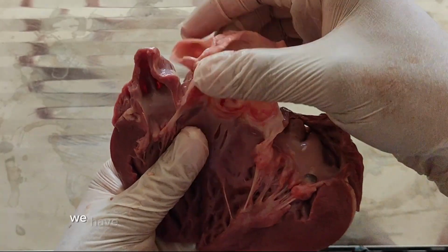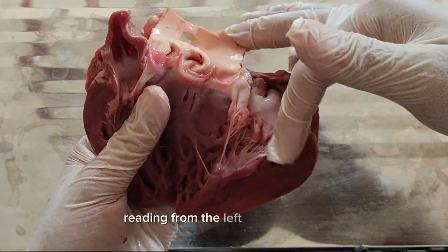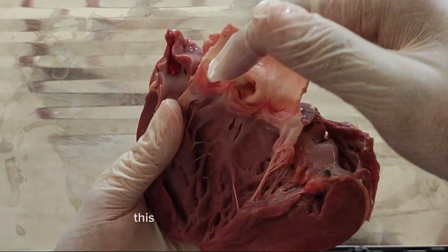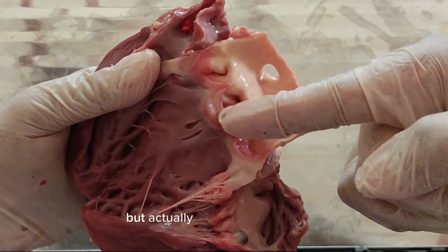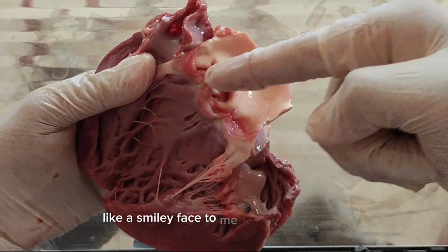On the inside, we have here the three flaps or leaflets on this valve leading from the left ventricle into the aorta, and note their half moon shape. As you can see here, these leaflets are actually half moon. The leaflets are like a smiley face to me. Smile.